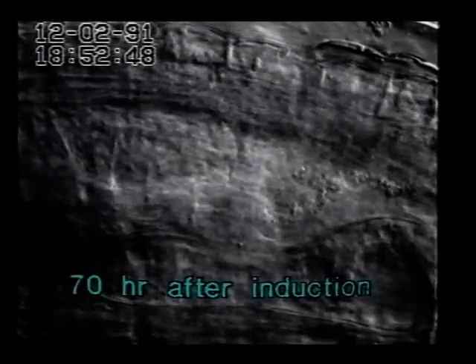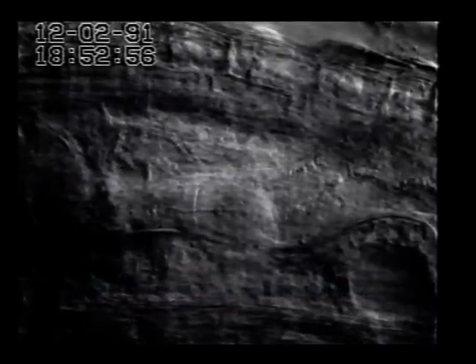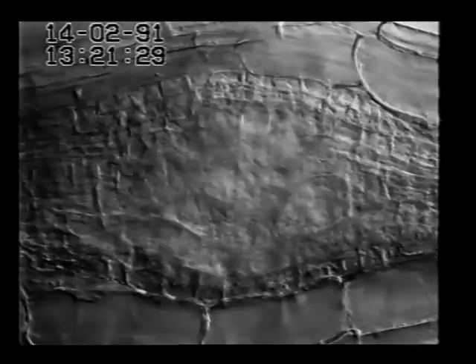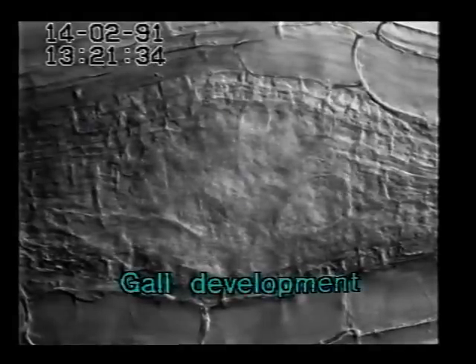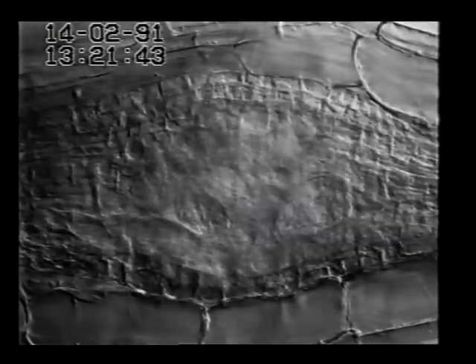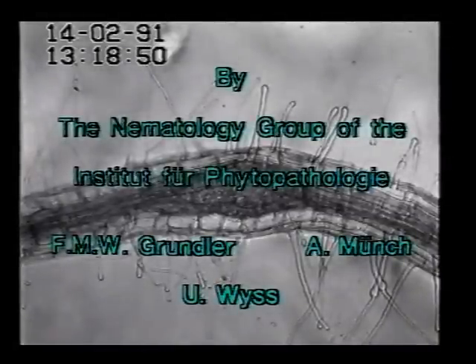About 70 hours after the induction, the swelling of the root tissue forming a gall prevents further detailed microscopic observations. The pumping median bulb is the only nematode structure which can be recognized clearly. The juvenile proceeds feeding in gradually prolonging pumping phases until it will finally molt. Within three days, the juvenile has induced this gall. It contains the giant cells and the developing juvenile. The extent to which the gall will grow is dependent on the host plant. In Arabidopsis, the galls remain small, often so small that the young adult females protrude from the gall.